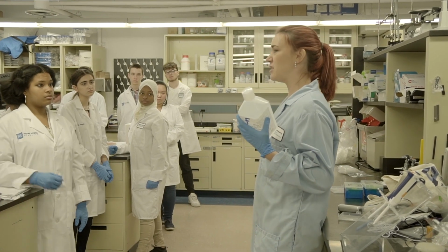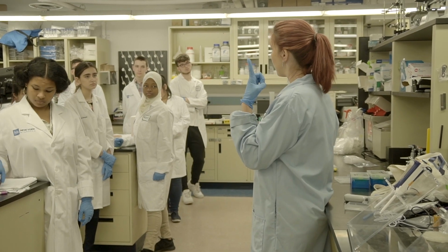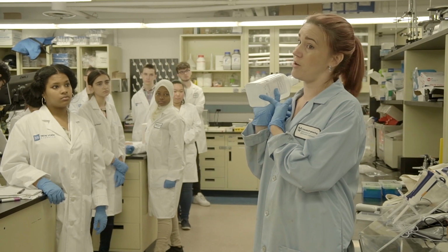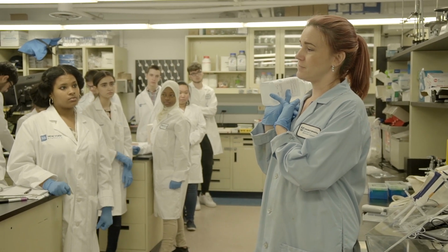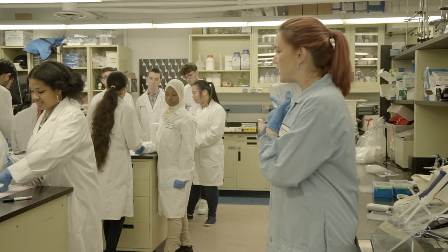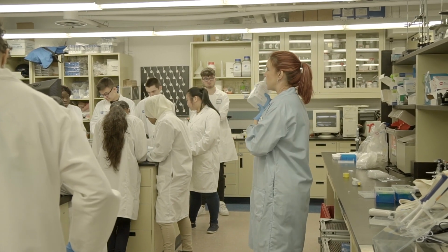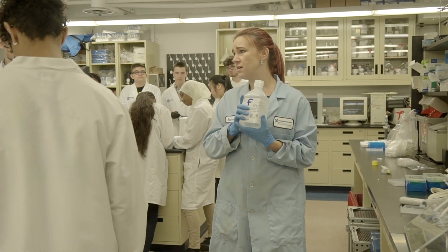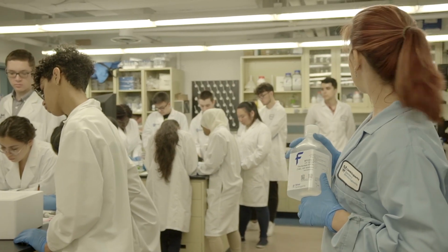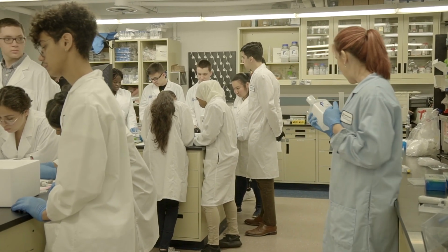It'll be really easy to make just a liter of this, right? So I have 10x buffer, I want 1x buffer and water. How much of the TAE buffer do I need and how much of the water do I need? You guys can jot down if you want to figure it out. Remember this is C1V1 equals C2V2. My final concentration is 1x and 1,000 mils, or 1 liter. My starting concentration is 10x, so I need to know how much of the TAE buffer and how much of the water.